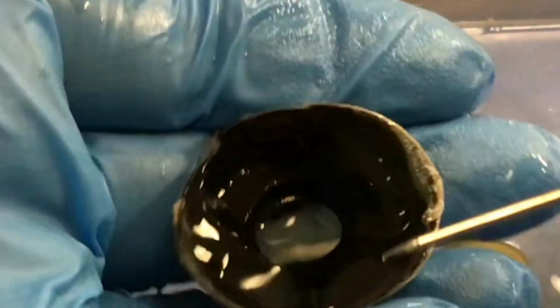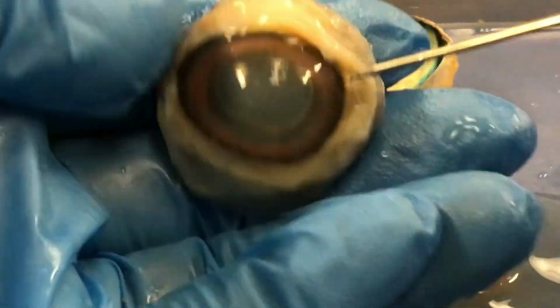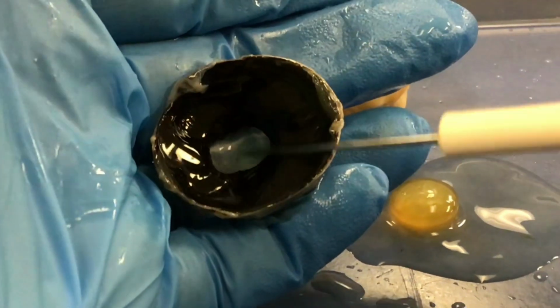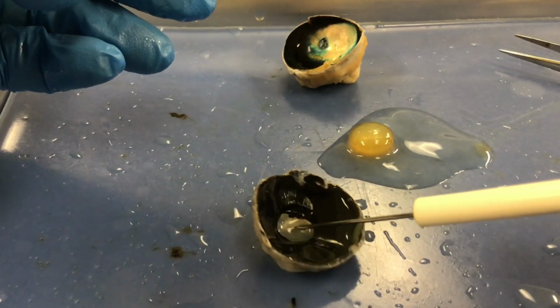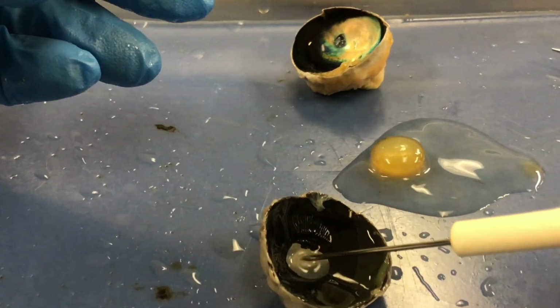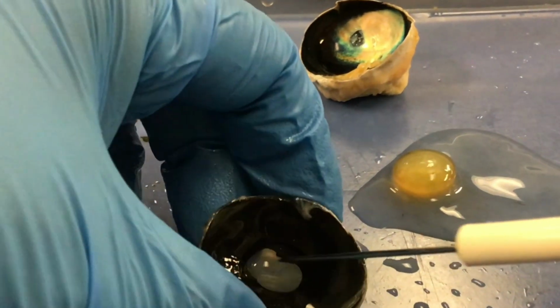Now I'm going to pull this over. This is the anterior part of the eye. So this is like we're looking at it from behind. So we labeled the cornea, the iris. But here you can see that hole there, that is the pupil. And you can see where my pointer is pointing through, that is pointing at the cornea. So the hole is the pupil, and the cornea is part of the sclera. Okay, that would just be anterior for that.